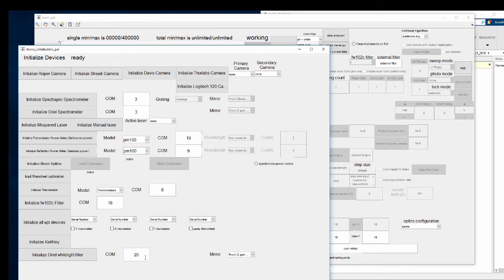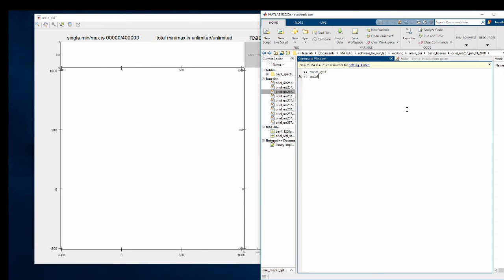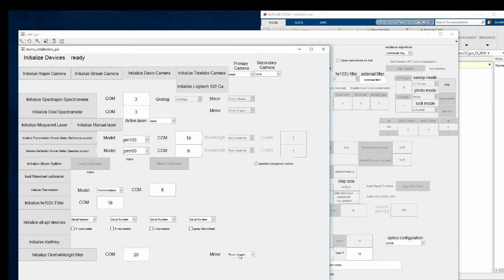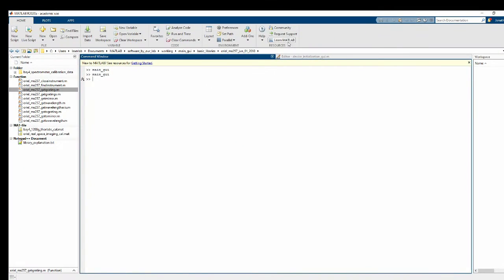So what we want to do now is code in that it'll automatically disable these buttons if it's already been initialized. And one other thing I'm noticing there is that the mirror selection was already available before I turned on the device. See how this is here? If I call this without initializing, I'll get all sorts of errors. So we need to gray this button out similar to these buttons up here. I'm sure there's a few ways we can do that.